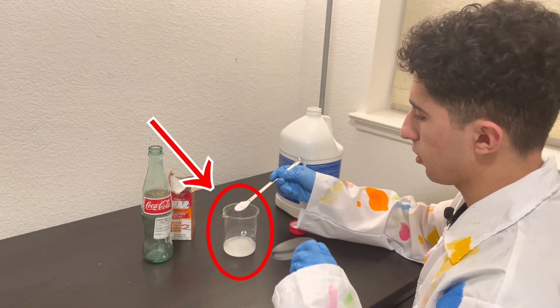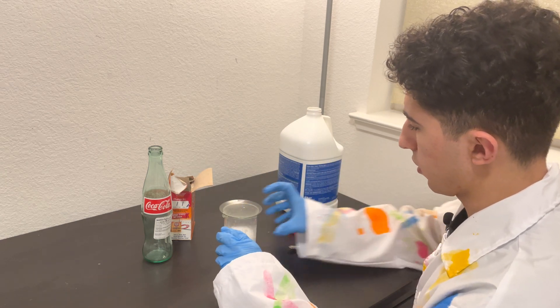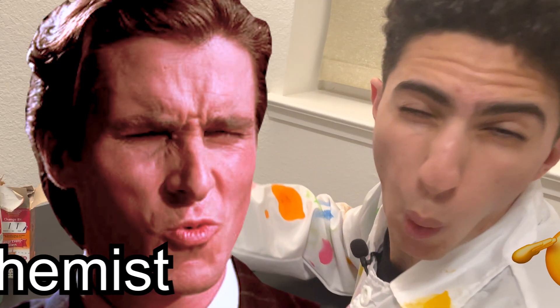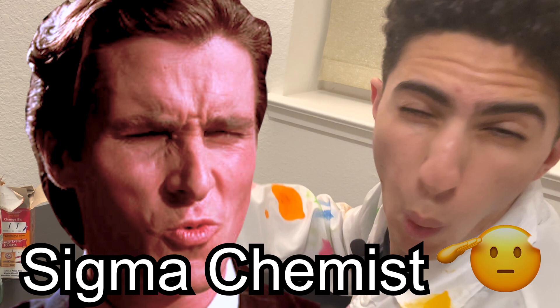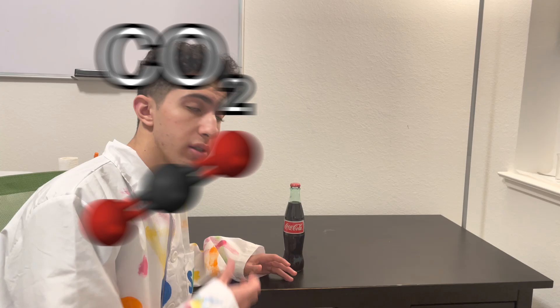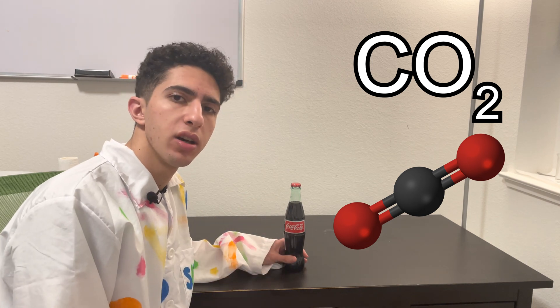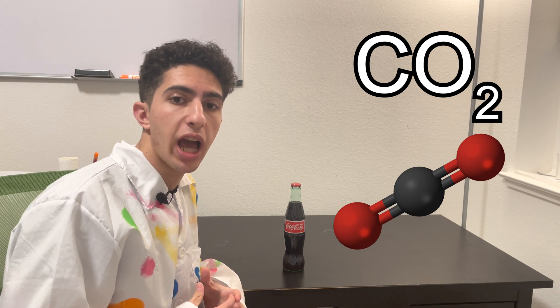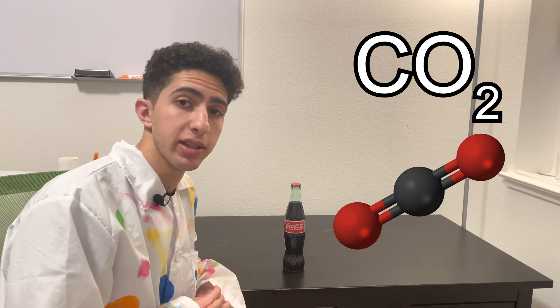With the watch glass ready, I'm about to create a chemical that will completely change my state of mind. Have you ever wondered what carbon dioxide actually tastes like? Not when it's dissolved in water or in a drink, but as a pure gas? Well, I wanted to find out, so I tried to create a sort of apparatus to allow me to taste CO2.